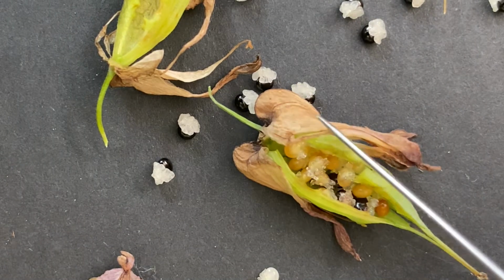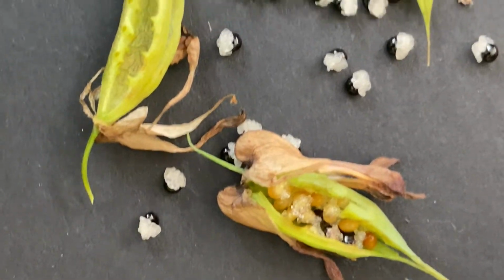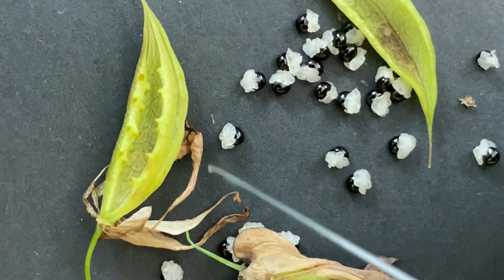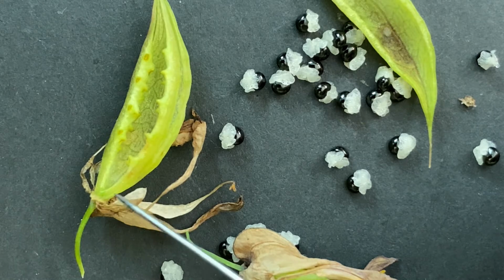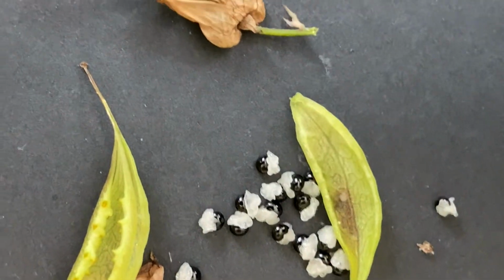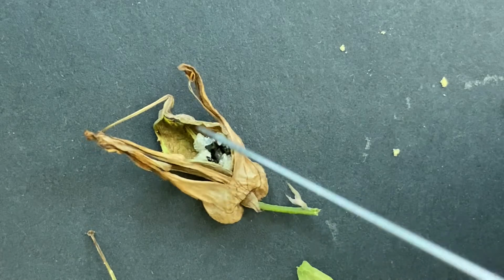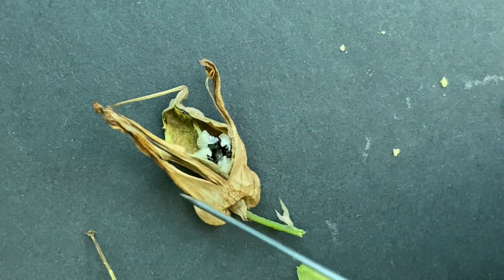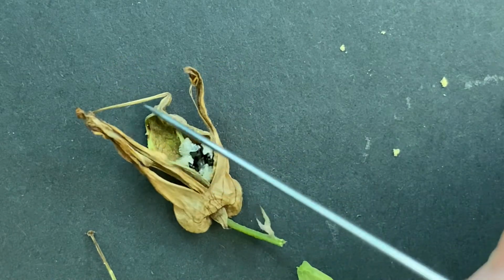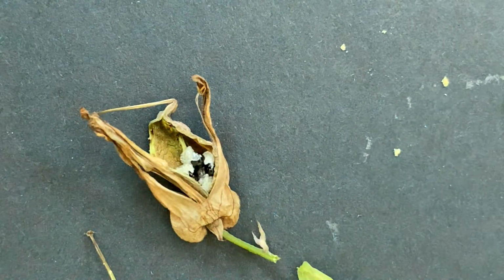And this, all the sepals and right here's the corolla. Really dry. And then even more dry, corolla, stamen, calyx, and then I don't even know if there's a little bract anymore. All the seeds are coming out. And then at the very end, everything is dried up. There's your bract still hanging on. Sepals or calyx, all of them. And then I think that this is the corolla, even though it's really sad and tiny. Here's your ovary. The ovary's all dried up and the seeds are just coming out on their own.